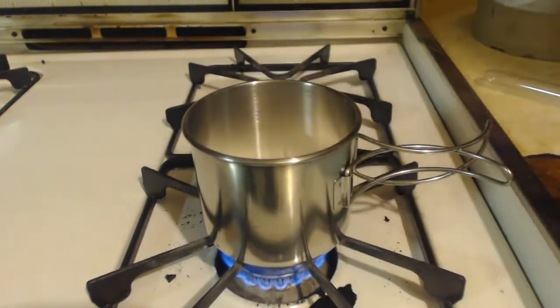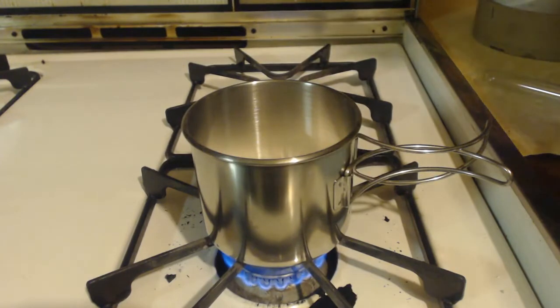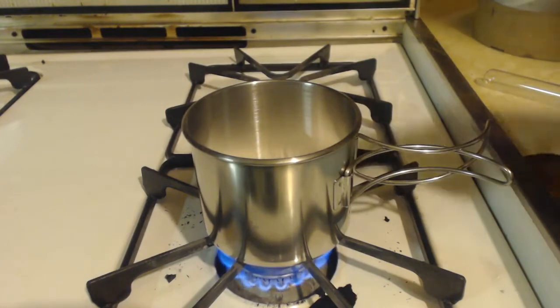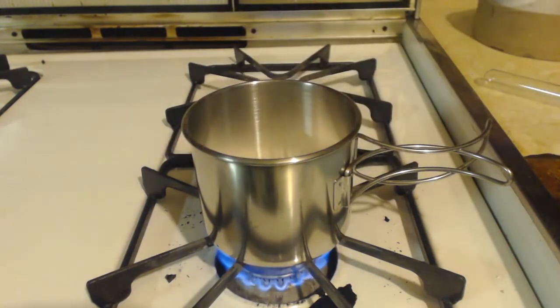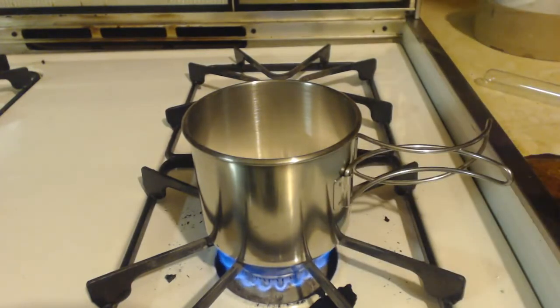Nothing really exciting is going to happen here. It's going to take a while. When it does get up to temp, I will come back and light a match and see if the carbon dioxide takes it out. There's another special thing about calcium oxide: if you take it up to like 2,400 degrees Celsius, it's used for limelight.